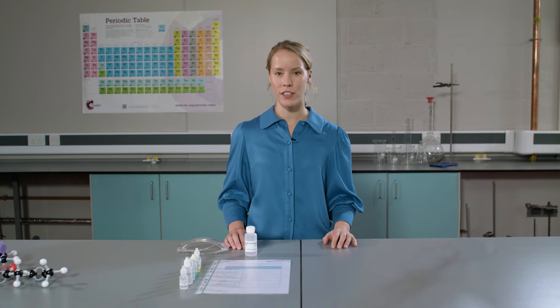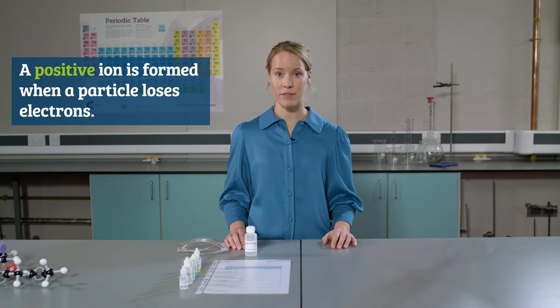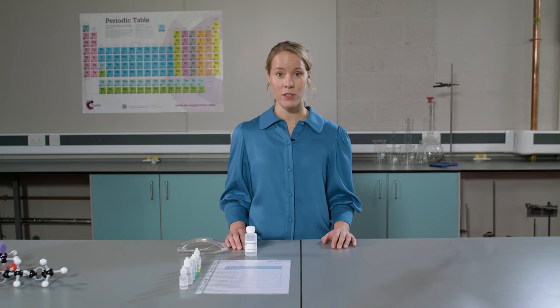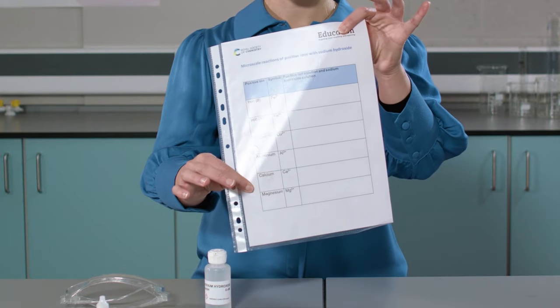Now we move on to the sodium hydroxide test. This is the test for positive ions in a solution. I'm going to be doing this test on a microscale level. However, the same experiment can be done on a larger scale using standard test tubes. In this experiment, the results table is also where the experiment takes place.